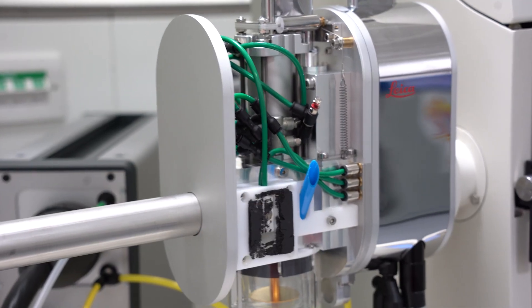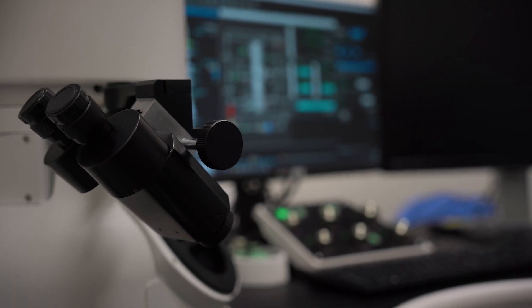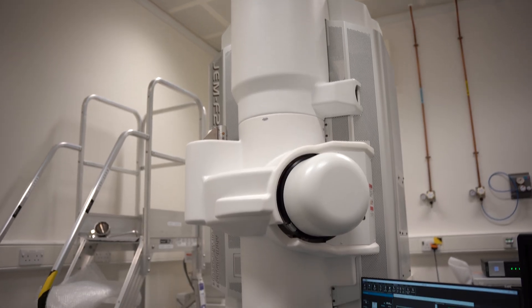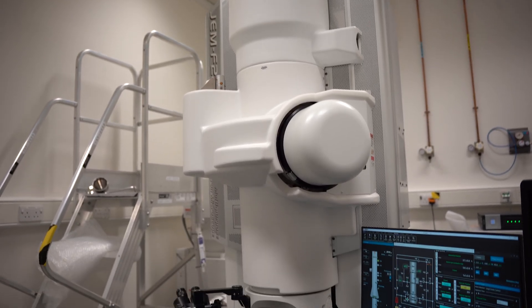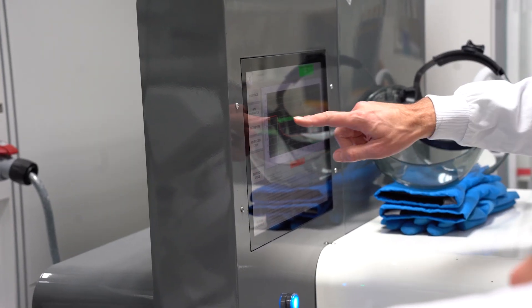When electrons are fired from the filament at the top of the microscope, they pass down the column. But electrons can't travel through air — all of the air molecules will deflect the electrons and you wouldn't get an electron beam. So the whole microscope has to be kept at high vacuum constantly, 24 hours a day, every day.